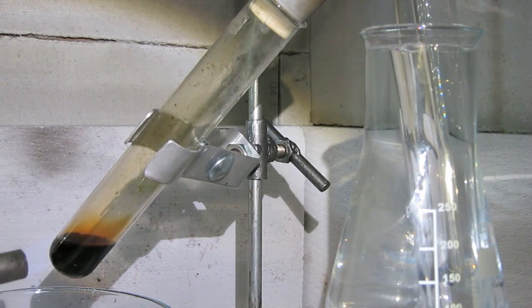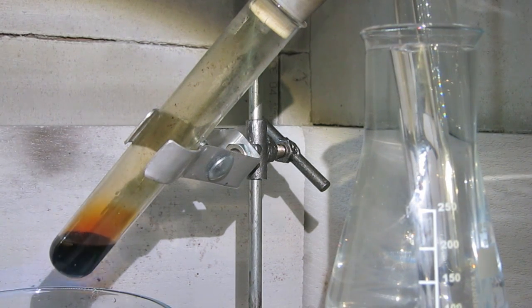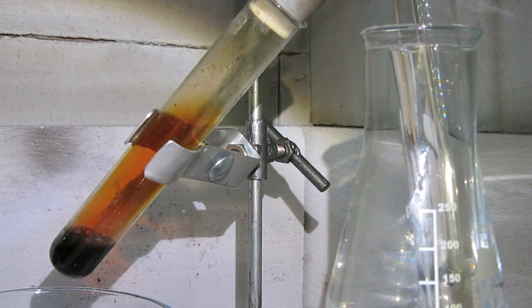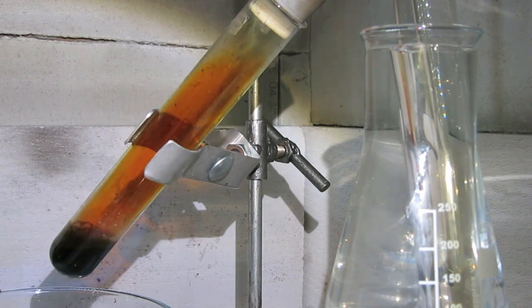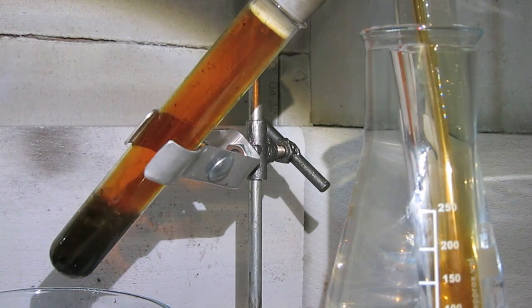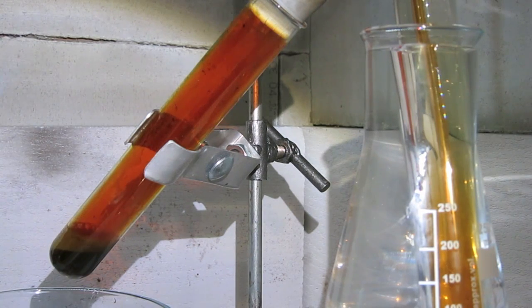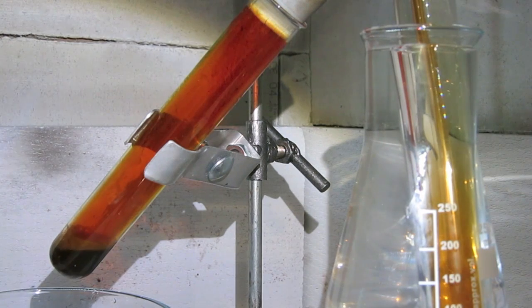You see now, see now the bromine. The red-brown fume and the bromine vapor above the solution. And the bromine goes into the cold one. I hope it will be condensed now. And you will see it. Lots of bromine vapor up here.